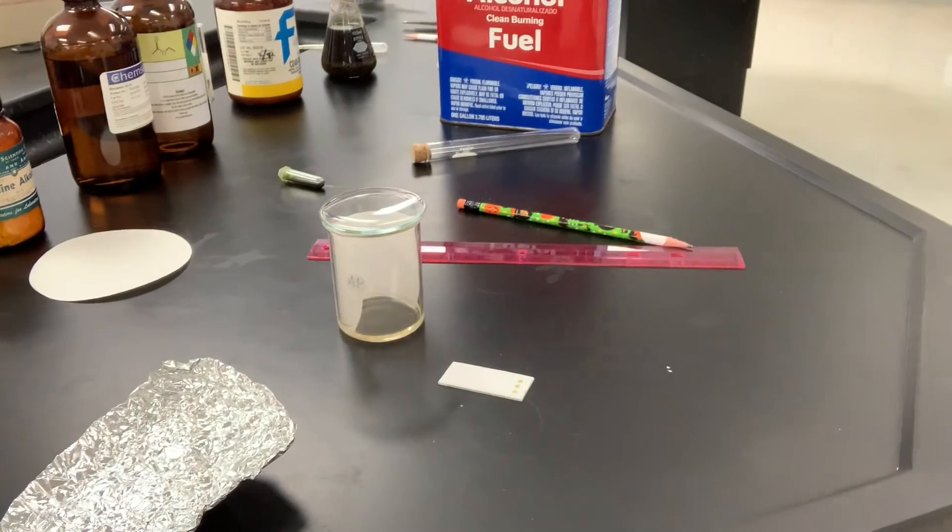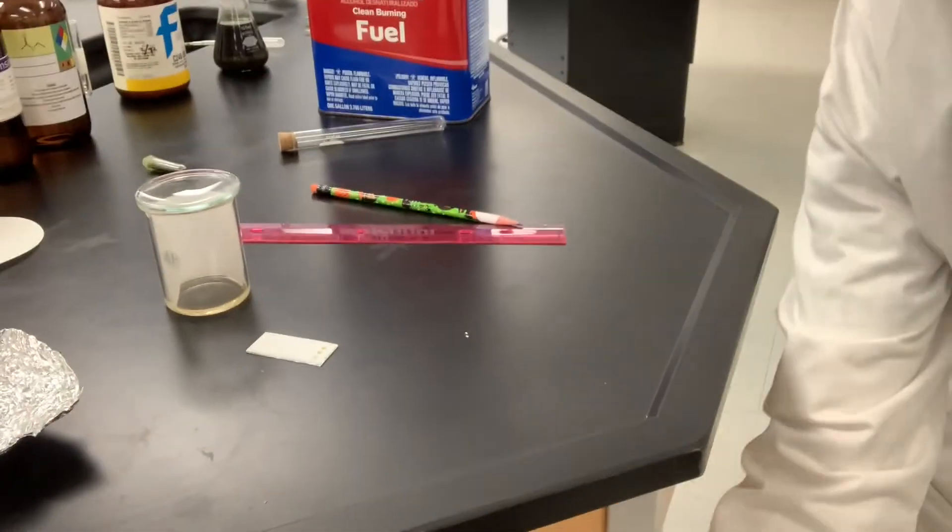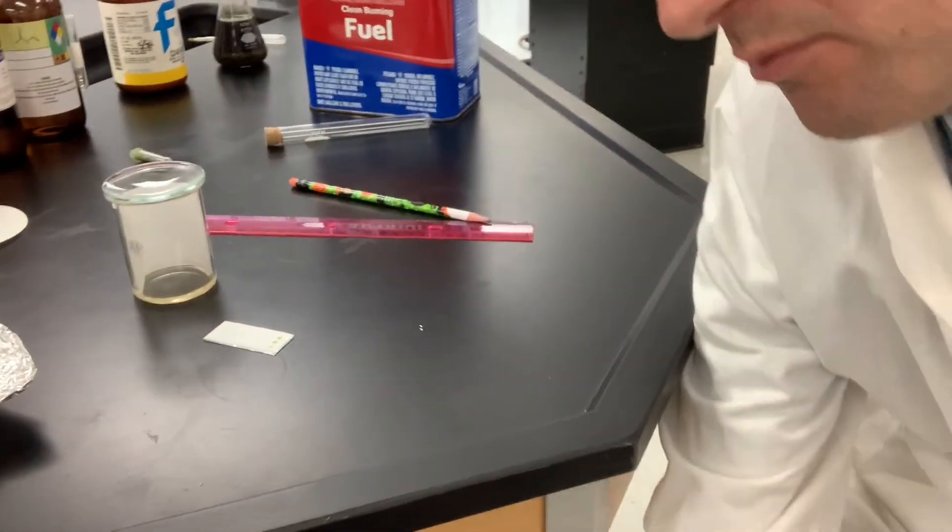Because chlorophyll is colored green, you'll actually be able to see the mobile phase go up. And I'll adjust the chair here so we can get this down.